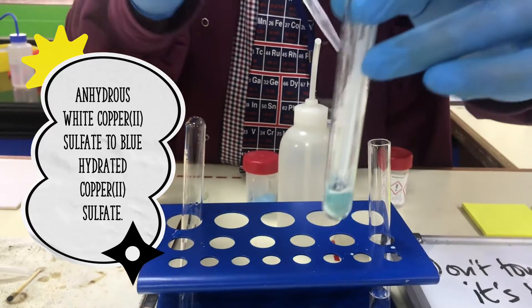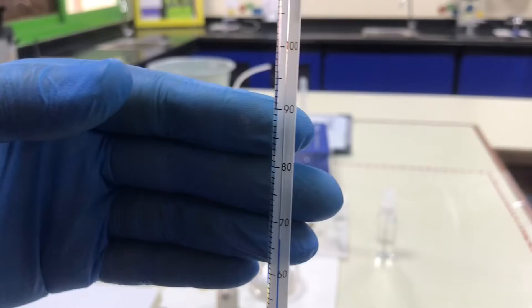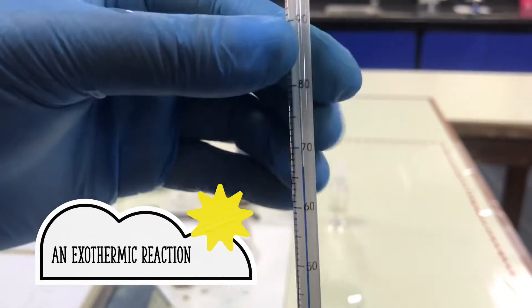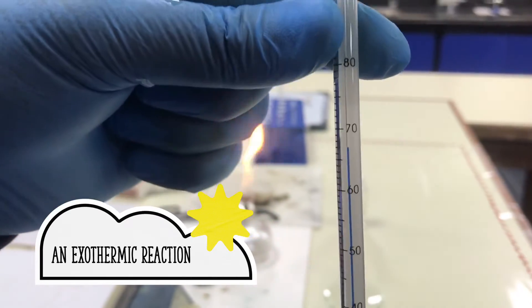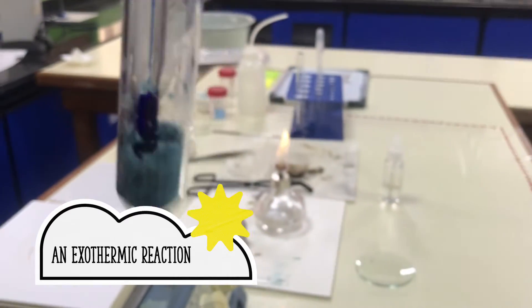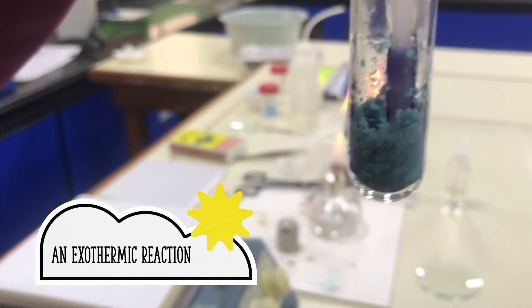When I added this it also fizzed. So over here we've still got a very high reading on the thermometer, between 60 to 70. You've got the formation of our hydrated copper sulfate.